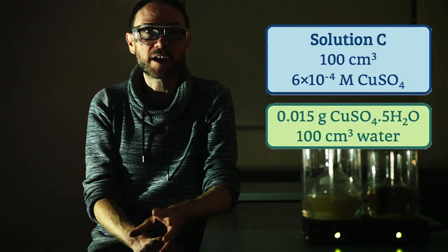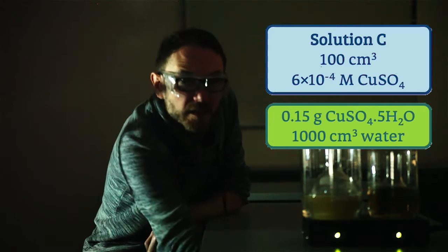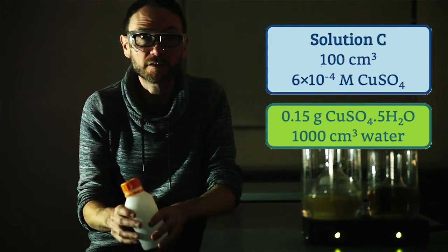Now, this is such a small amount that I just tend to weigh a larger quantity, make up about a liter at a time, and the leftover stuff I can leave in a stock bottle for the future.